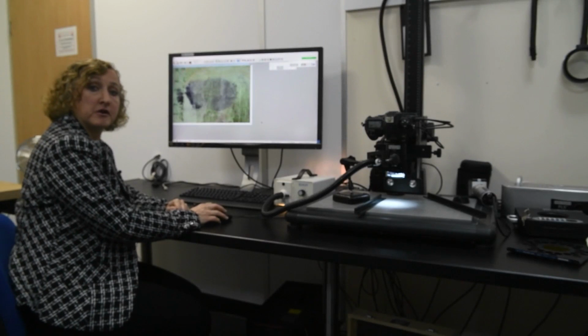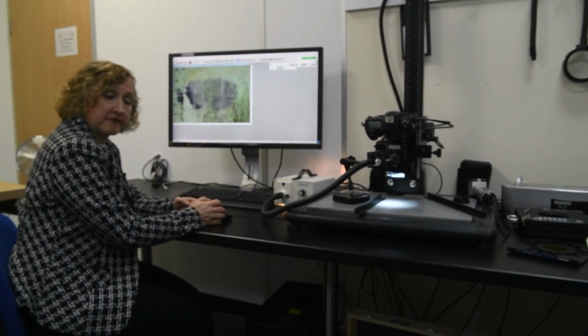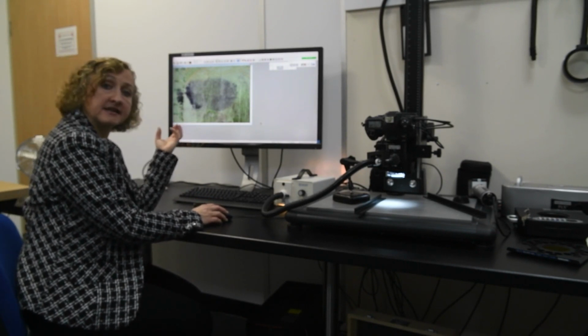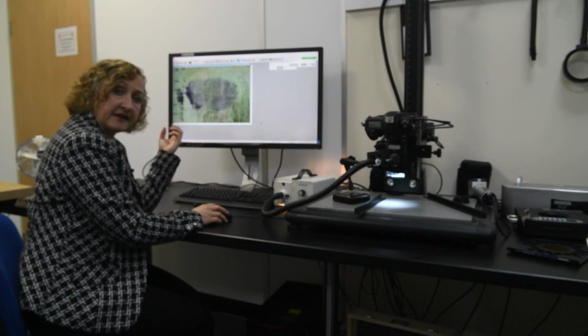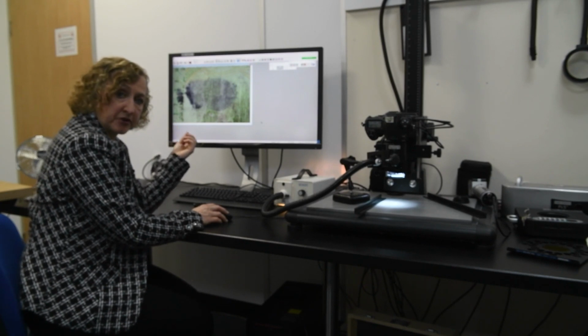Okay, the image that we're looking at here, again, we have ninhydrin and it's on currency. We've already captured the image correctly using daylight and the correct adjustment with the polarizing filters. Now this image will require slightly different enhancement processes.